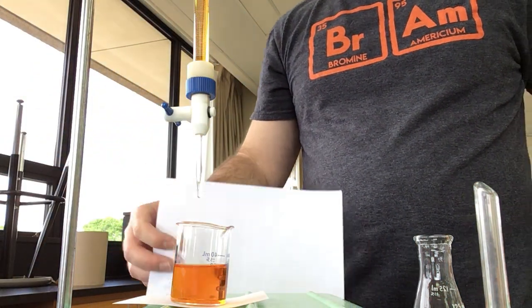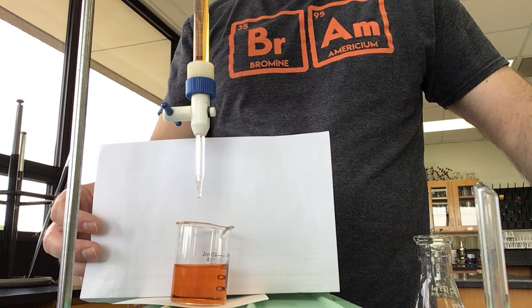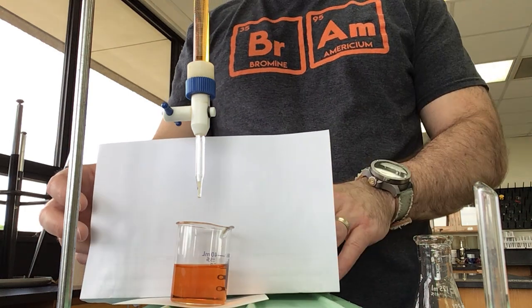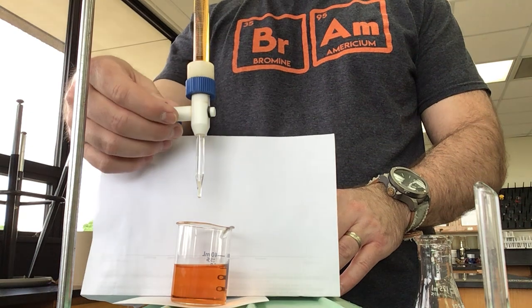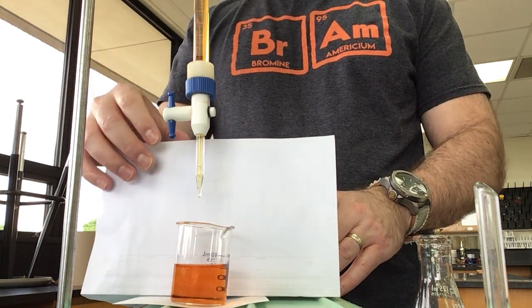All right, just a quick video on cleaning out our burettes whenever we're done for the day. I've got a little bit of titrant I haven't used, so I'm going to drain that into my original beaker.